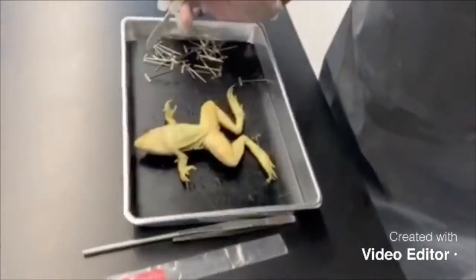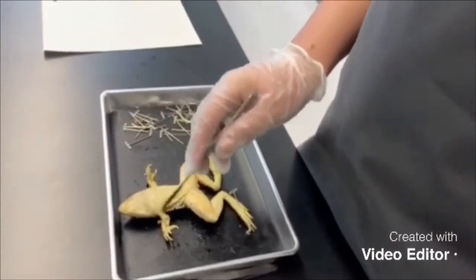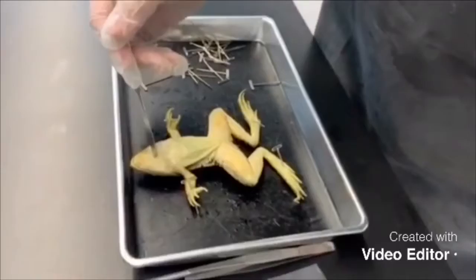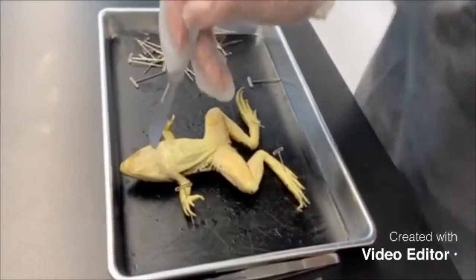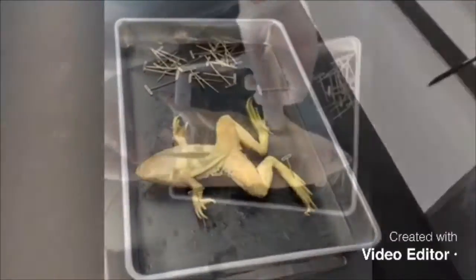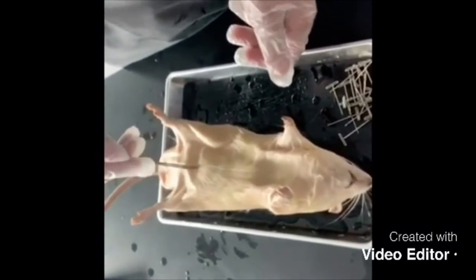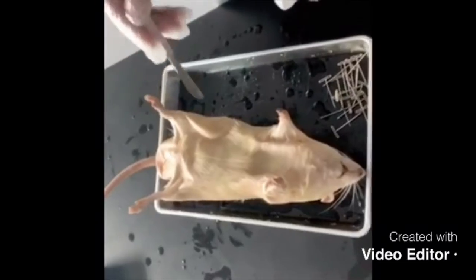To dissect this frog, secure the frog with dissecting pins on each of the four legs. Make an incision right above the mouth and right by the anus, and then connect the two incisions by a straight line. To dissect the rat, make an incision on the two arms here, followed by a straight line through, and a line connecting them all.